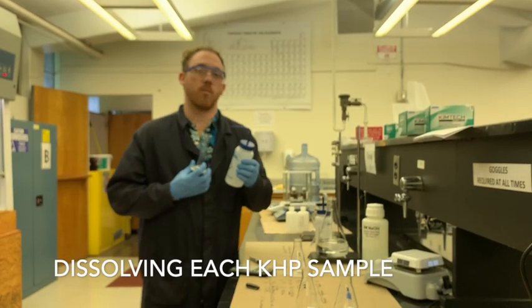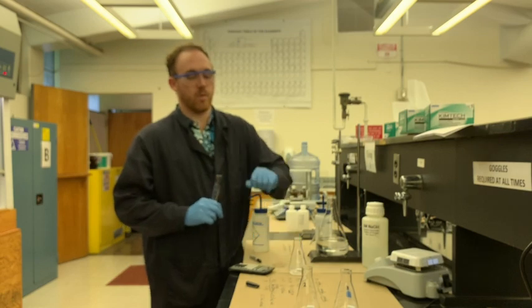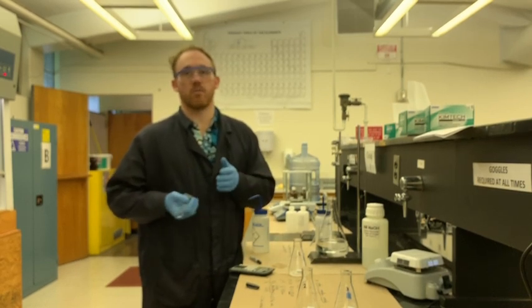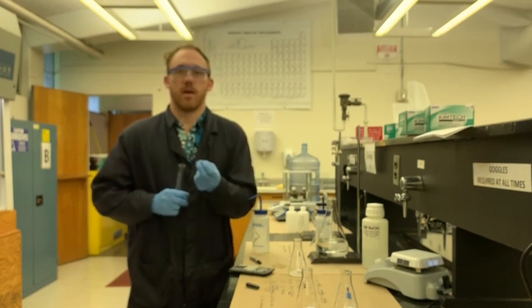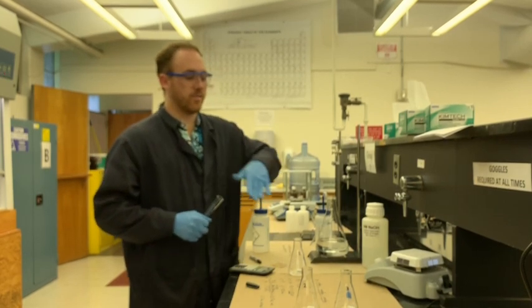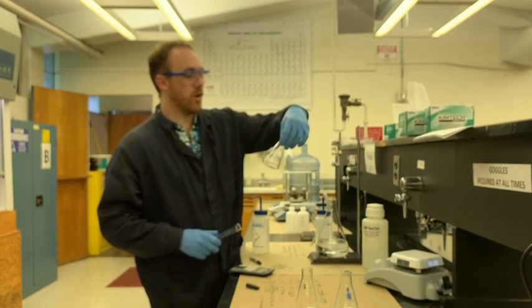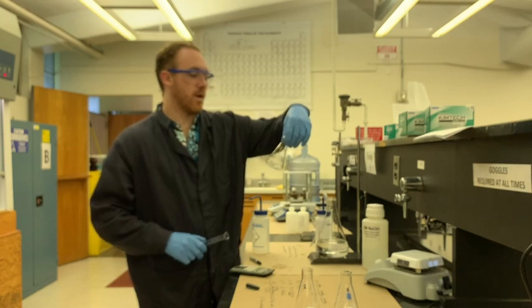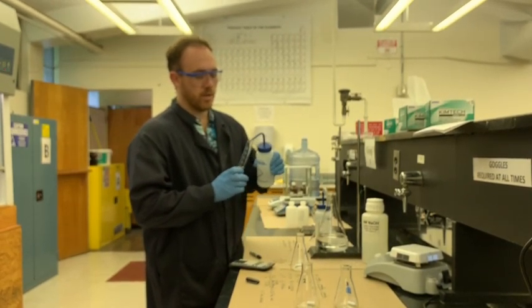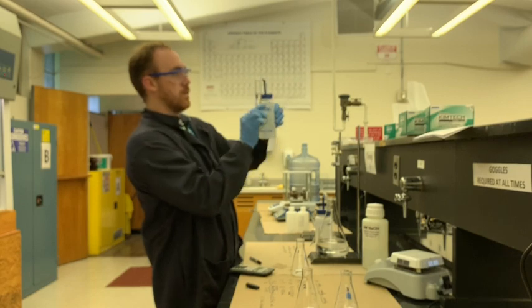It doesn't really matter exactly how much of the water you put into this flask. Why? Mostly because when you put water in this flask, you still have the number of moles of KHP that are going to fully dissolve no matter how much water you put in there. KHP is a pretty soluble salt. If you had a less soluble salt, you might go with more water. More liquid, though, is going to prevent as quickly or as effective mixing as you could have with a more concentrated solution. So you don't want to have too much volume to be working with your titrations, or too little volume. I think 20 milliliters is a good way to go, especially we have a 125 milliliter flask. You don't want to fill this much up past about 100 milliliters. That's going to be the point where you're a little bit past any amount of the solution that you'd want. You want to make sure that you're mixing effectively, quickly, making things easy for yourself. 20 milliliters.